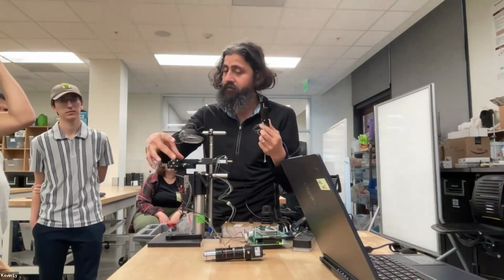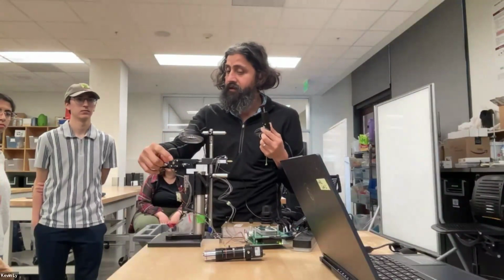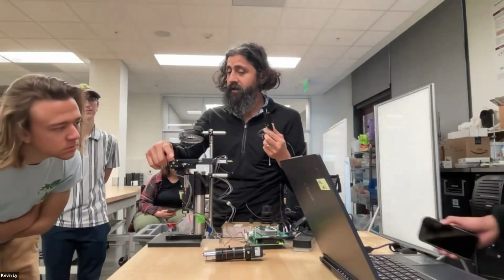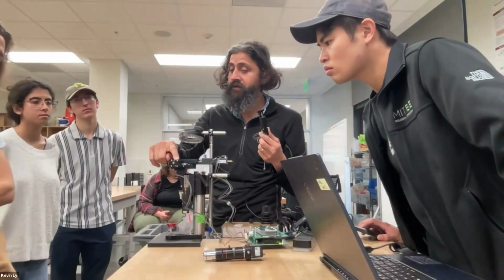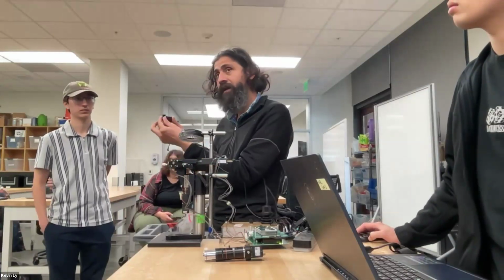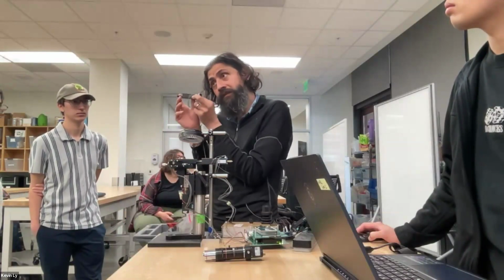You can spend some time, look at this. So another motor, the motor is just right there. You can actually see it's one of these NEMA motors. You can even see the plates. You see these plates right there? You can disassemble and remove this motor and put another motor, but now you have to convert this motor into a linear bearing. So this is a linear bearing that allows you to take the shaft of this rotary motion into what you care about most, which is linear motion.